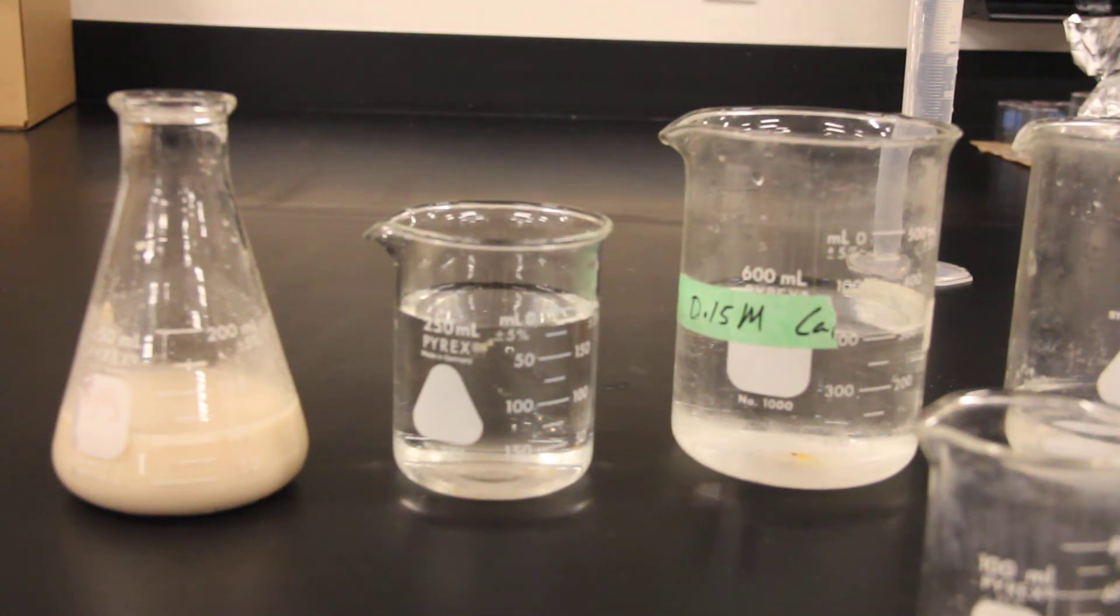Welcome Kodiak's, getting set up for measuring catalase activity using sodium alginate yeast spheres.